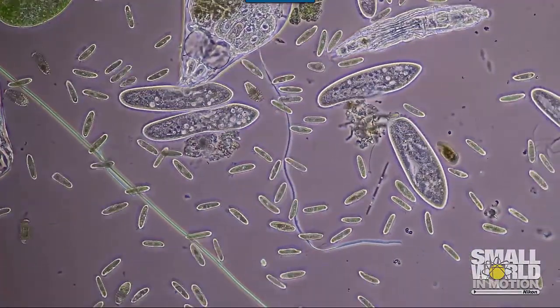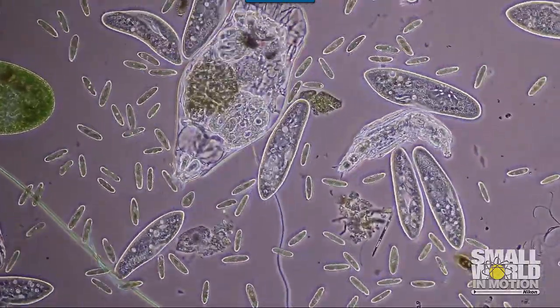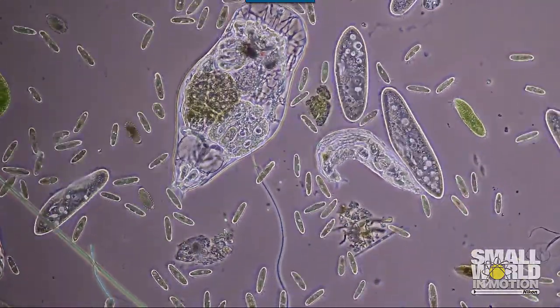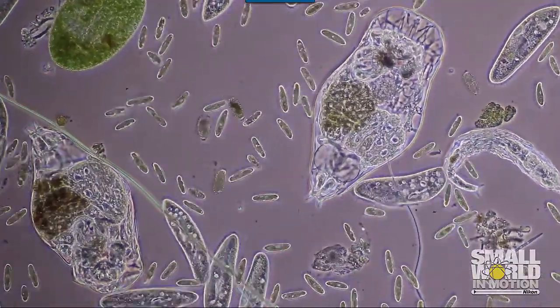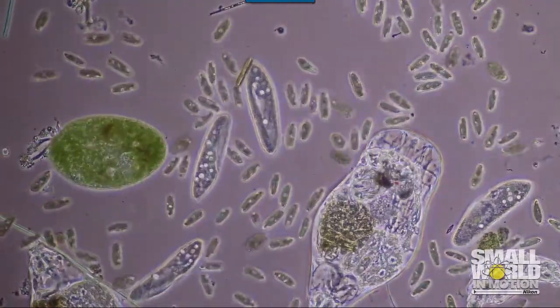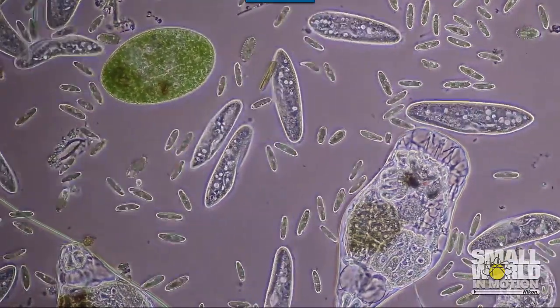Pond ecosystems are teeming with aquatic microorganisms that can be observed with your microscope. Single-celled organisms, some photosynthetic, along with multicellular invertebrates. Explore around and find something interesting to draw in your lab manual. Maybe you'll even see some of the organisms shown here. When you're finished viewing your slide, make sure to dispose the cover slip in the glass box. Wash your slide and set it by the sink to dry.